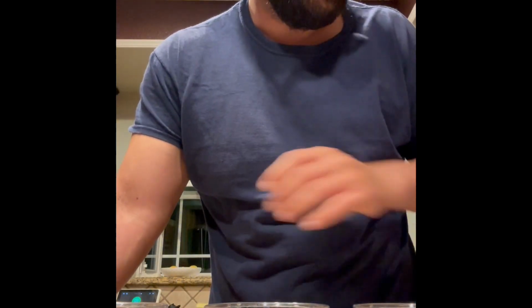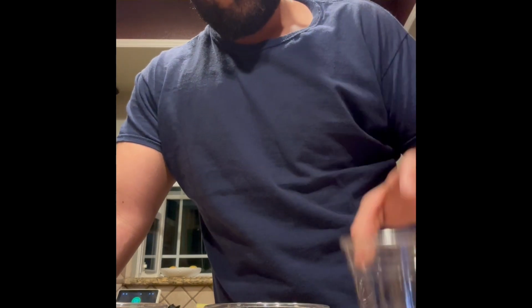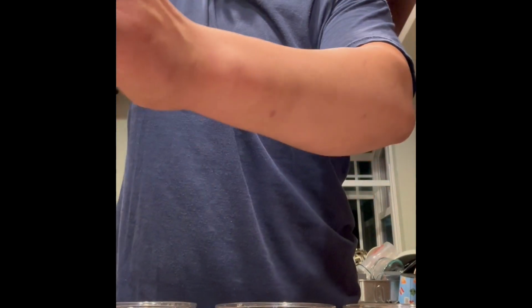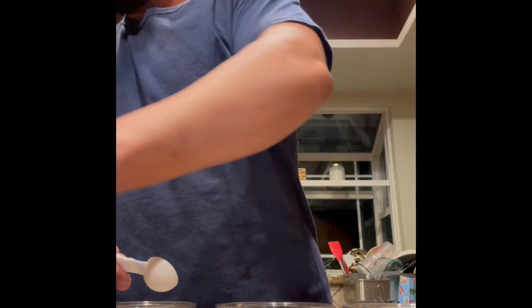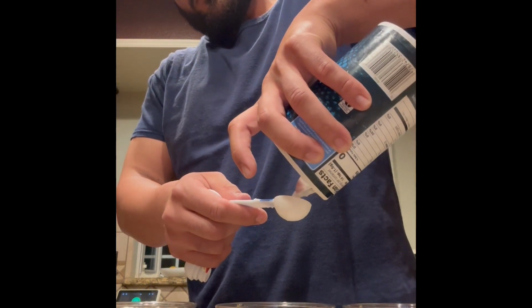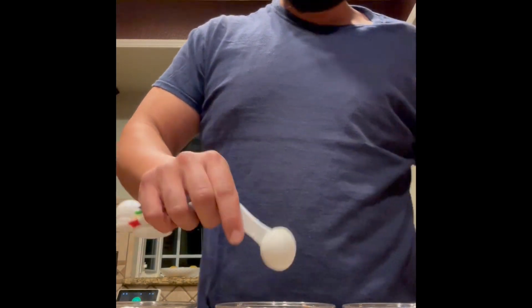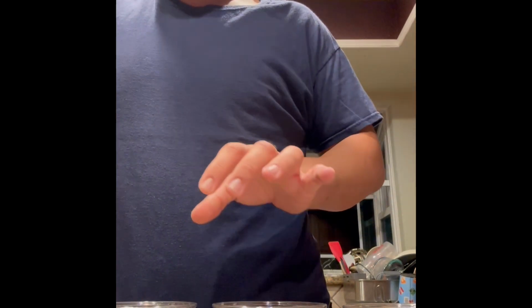So first we'll start by making the solutions. I went ahead and, off camera, filled up our 3 cups halfway with water. Secondly, we will grab half a tablespoon of sugar solute and place that in one of them, and then measure out half a tablespoon of our salt solute for our salt solution and place that in a separate cup.